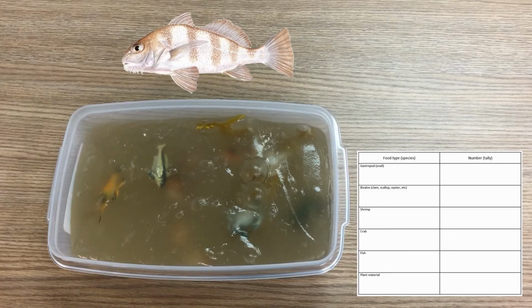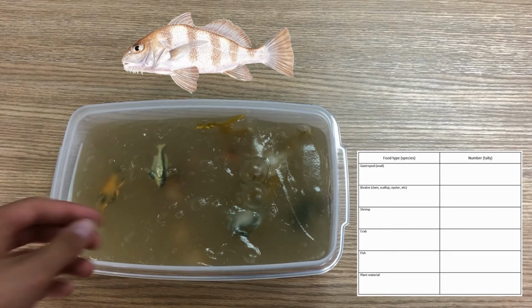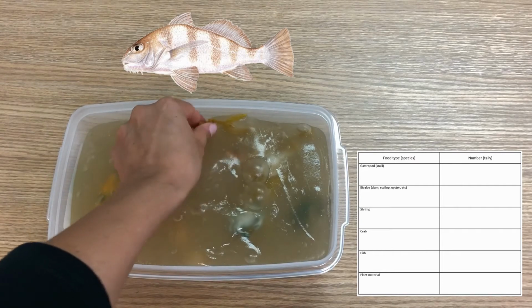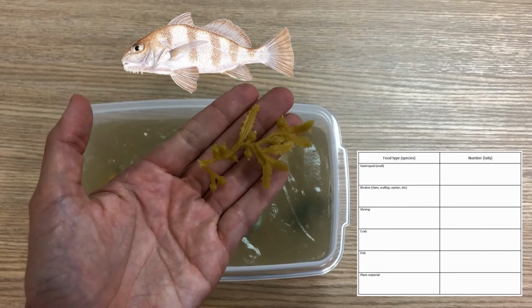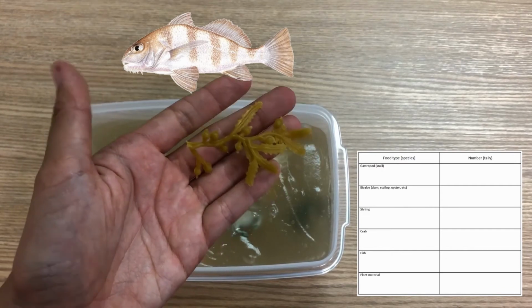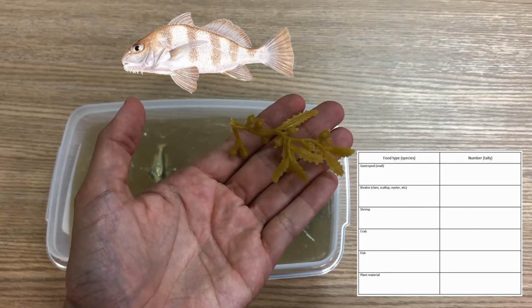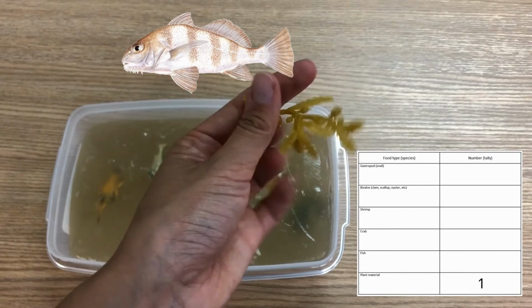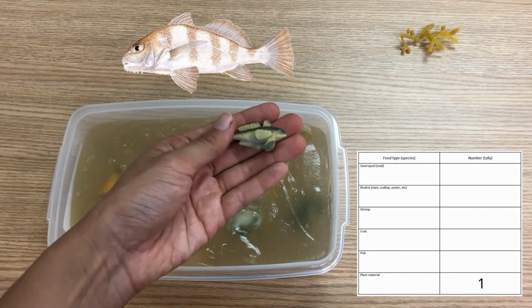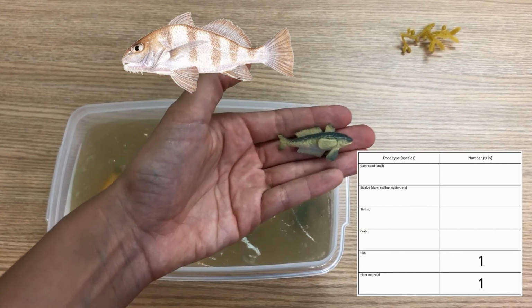All right, everyone, so now it is time to get into our black drum stomach. My sleeves again are rolled up and I'm ready to get into it. So let's see, it looks like we've got a few things up at the surface here, so I'll grab some of the easier ones first. And this is really cool, guys. So this is some algae. And algae is a type of plant that lives in the ocean. So we are going to go ahead and put a tally in the plant material column. And it looks like we have a fish. So black drum apparently also eat fish.